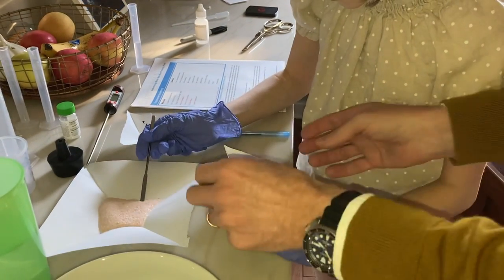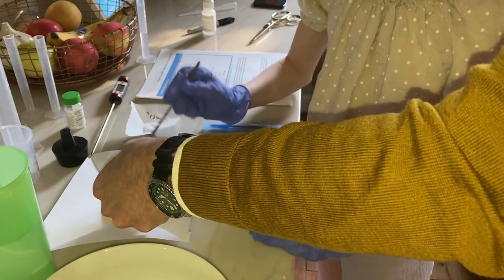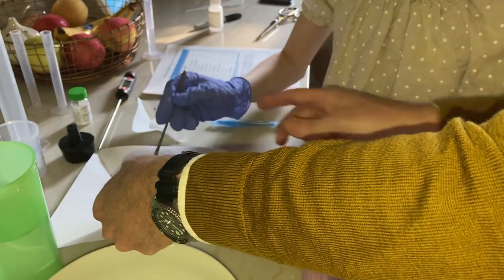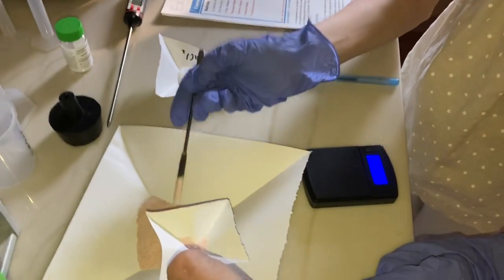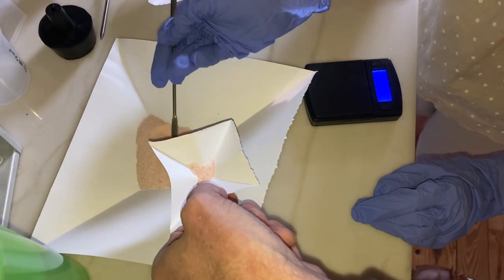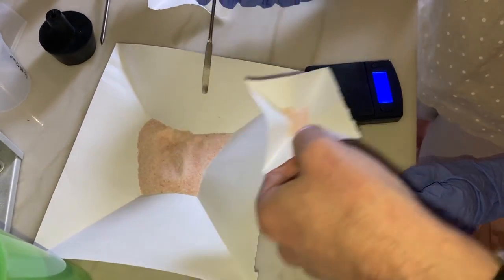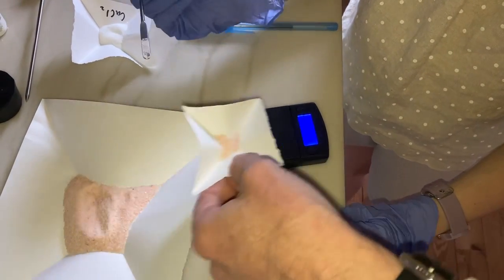Okay. You might want to bring this over here like that. If that was two grams of calcium chloride, that's sort of an estimate. Okay, let's see how much is here. Wow. It's supposed to be more dense.